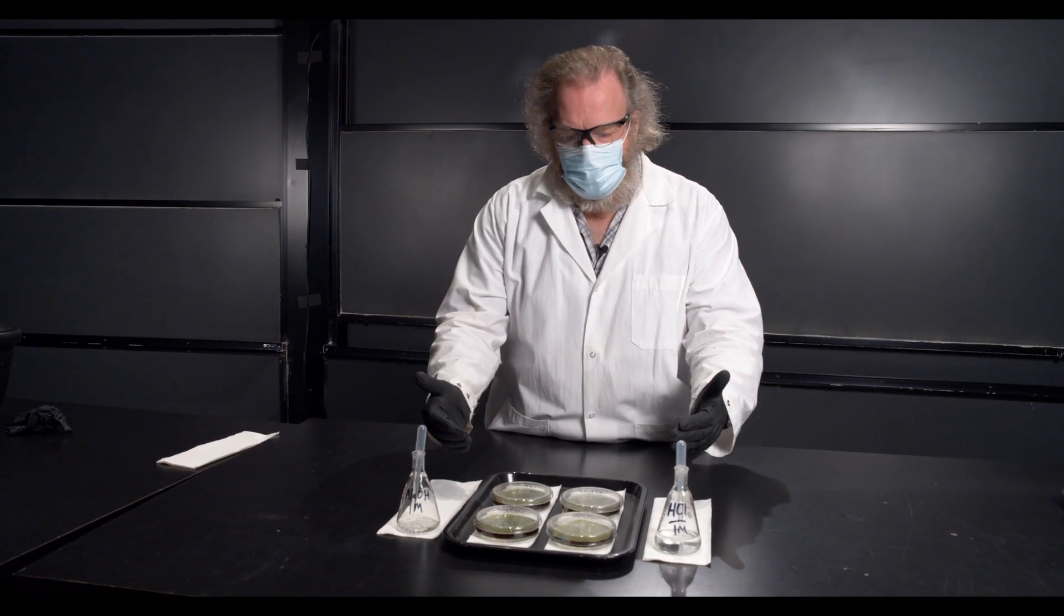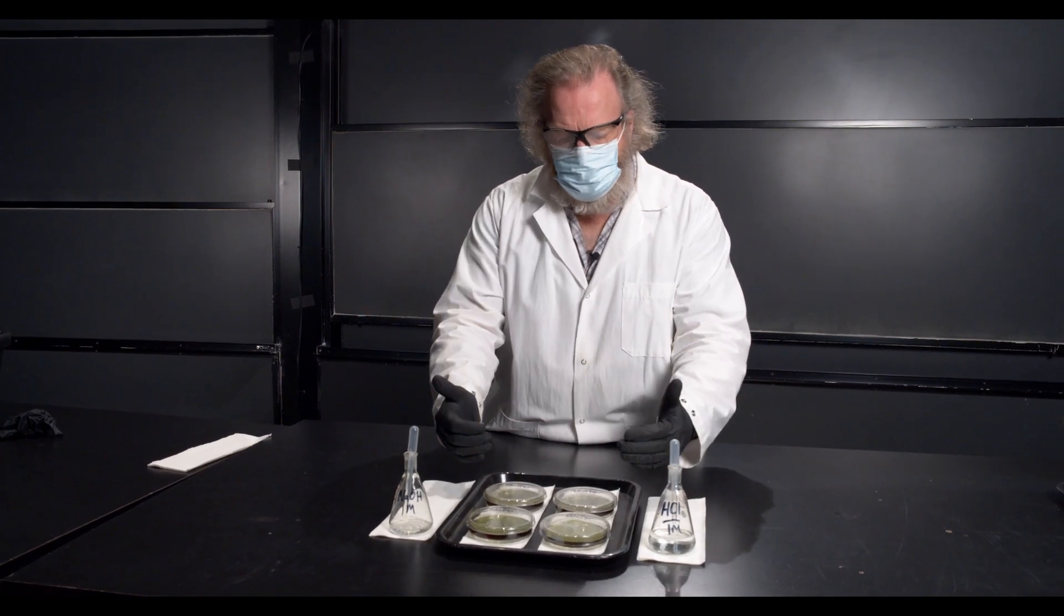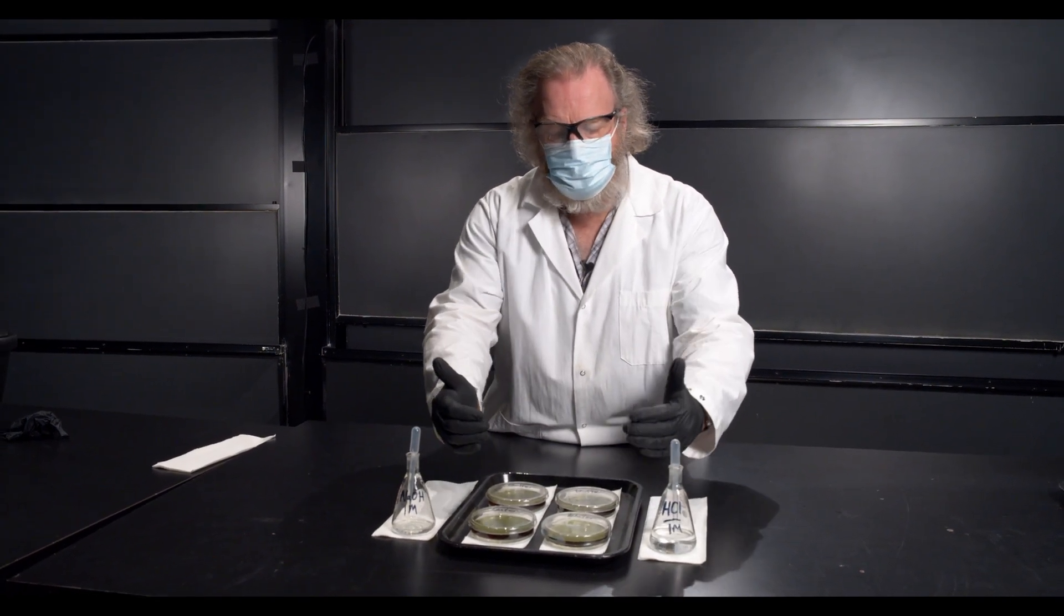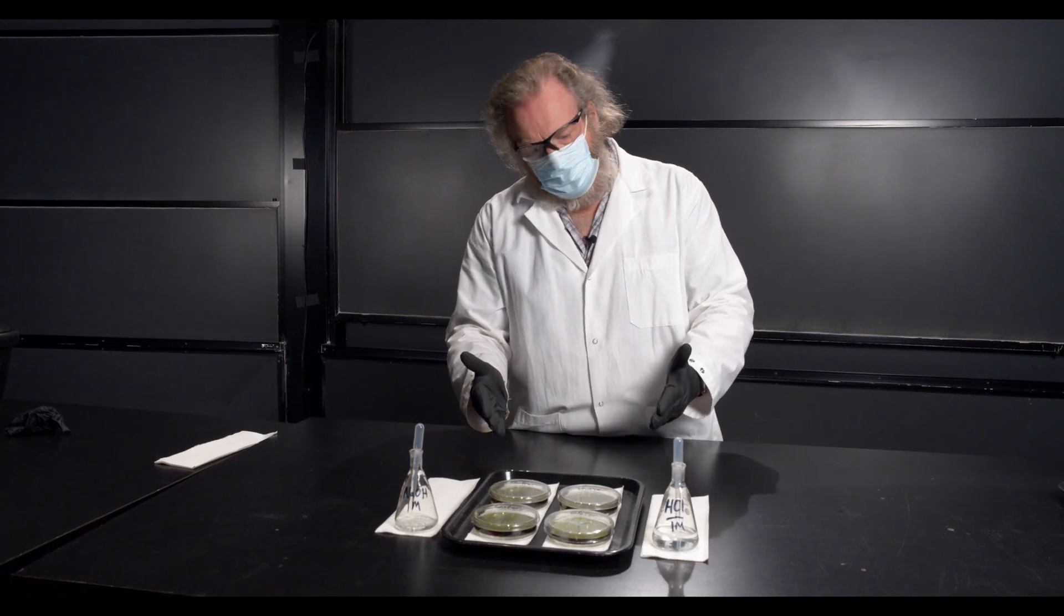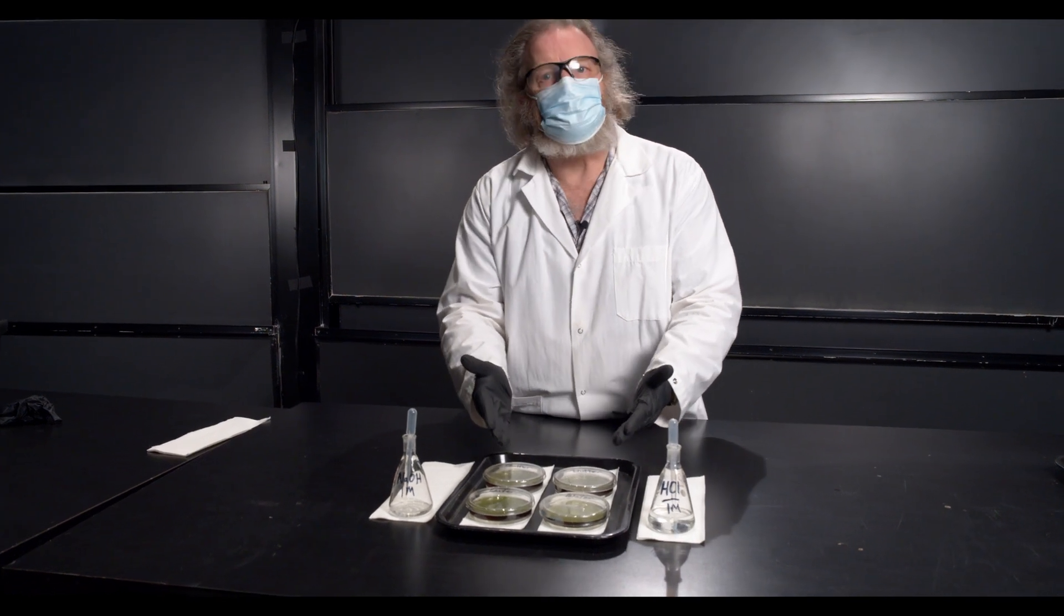I have a demonstration of pH buffers and I'm going to compare a buffer to pure water. And I'm going to start off with four solutions that are at pH 7, they're neutral solutions.